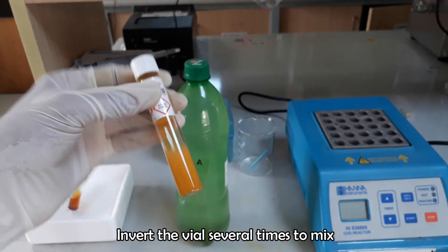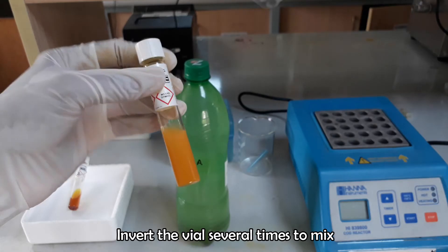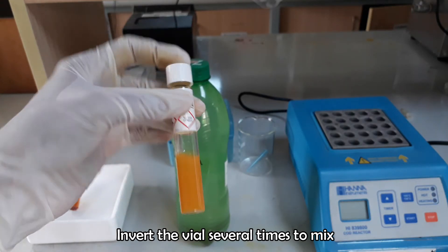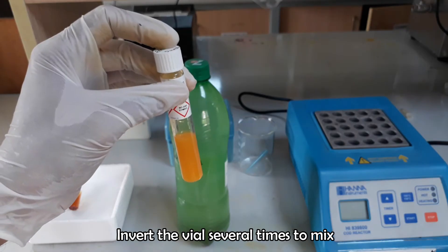Invert the vial several times to mix the sample with the reagent properly. The vial will become very hot during mixing, so use caution when handling.